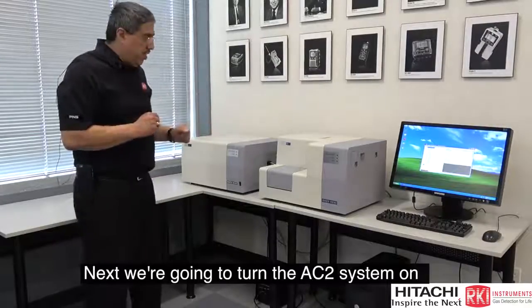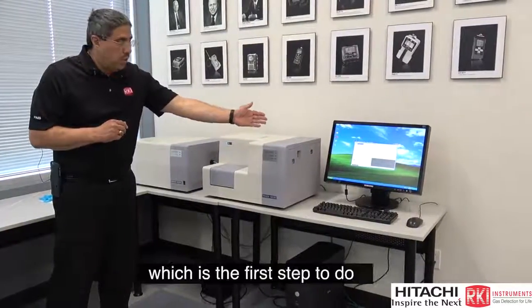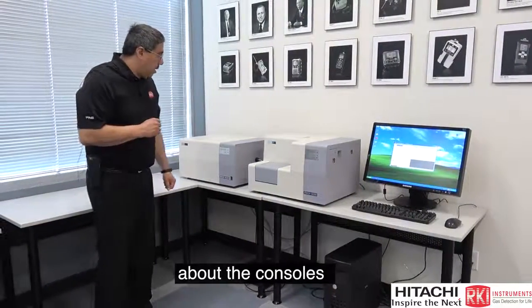Next, we're going to turn the AC2 system on. Before I do that, I want to direct your attention to the computer. We have the computer program open already, which is the first step to do, and we'll cover that program in much more detail later. For now, a few more comments about the consoles.